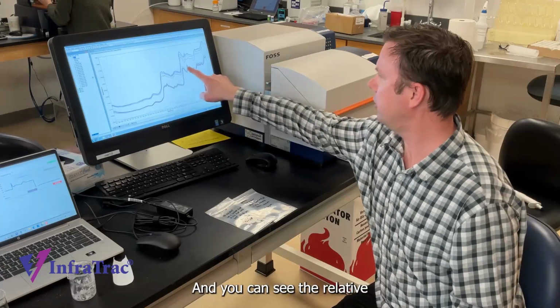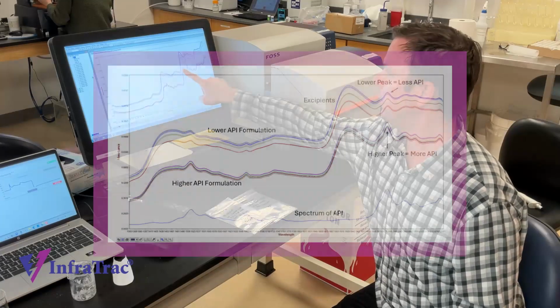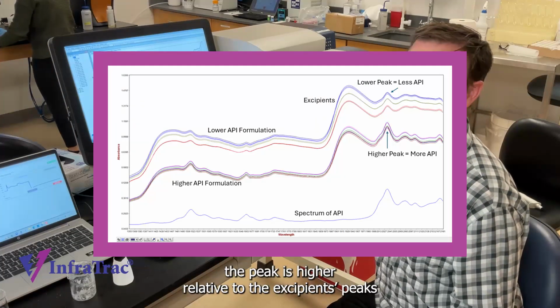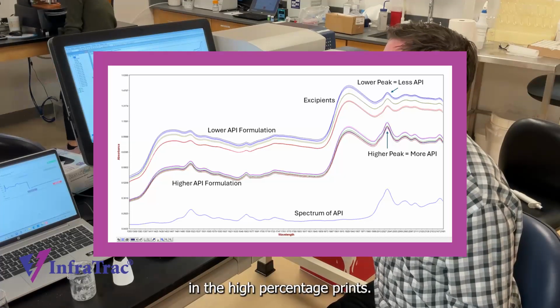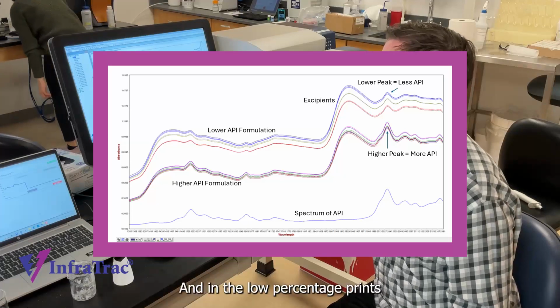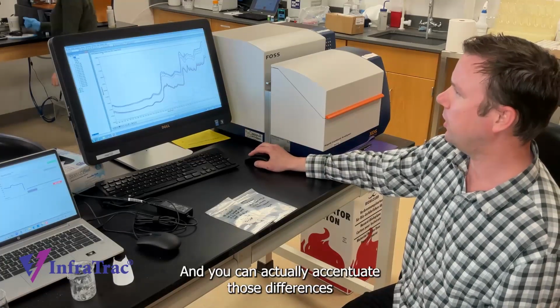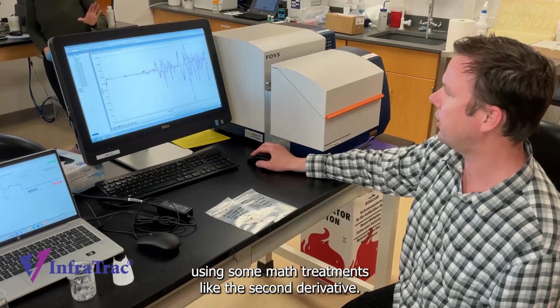And you can see the relative difference of this peak compared to the excipients in the higher dosage than in the lower dosage. So in the higher dosage spectra, the peak is higher relative to the excipients peaks. In the high percentage prints, and in the low percentage prints, the peak is lower compared to the excipients. And you can actually accentuate those differences using some math treatments like the second derivative.